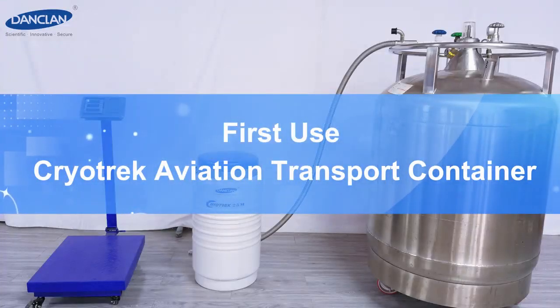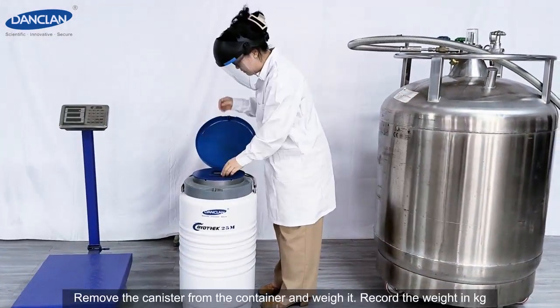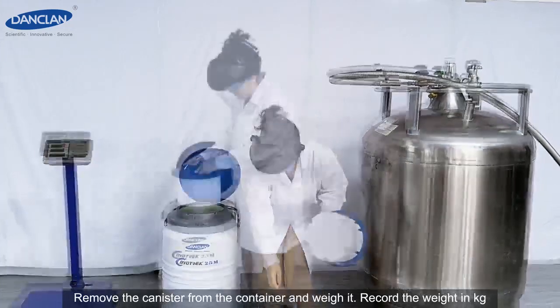First use, Cryotrek Aviation Transport Container 1. Remove the canister from the container and weigh it. Record the weight in kg.